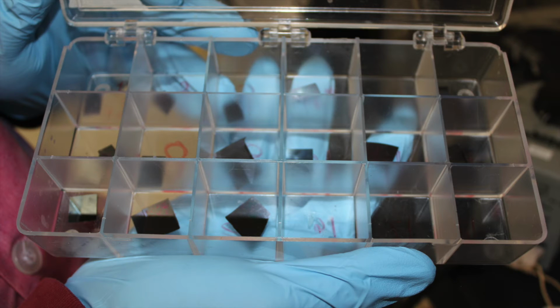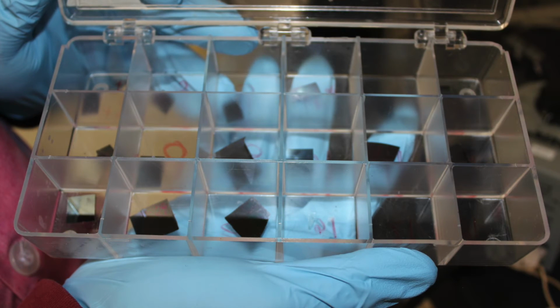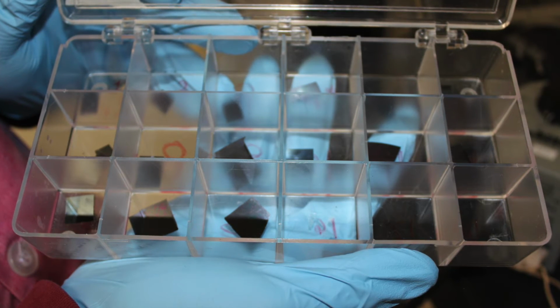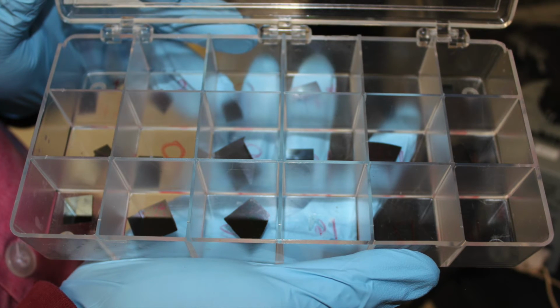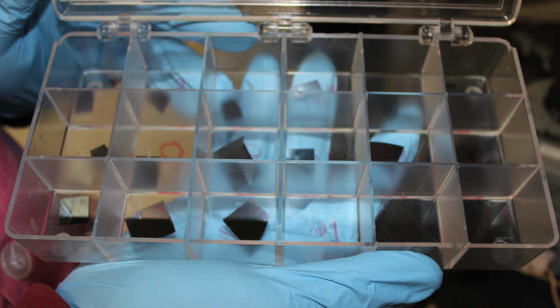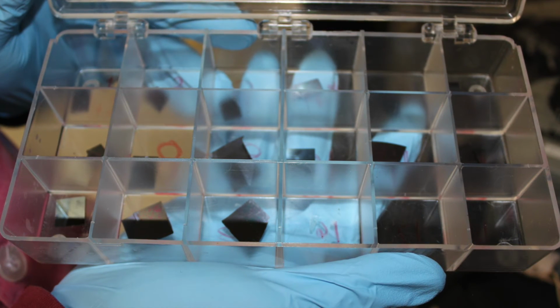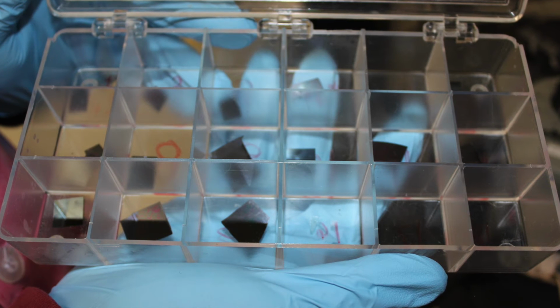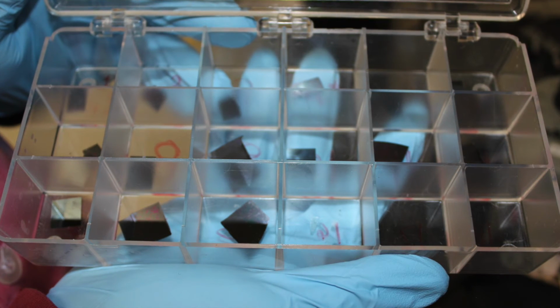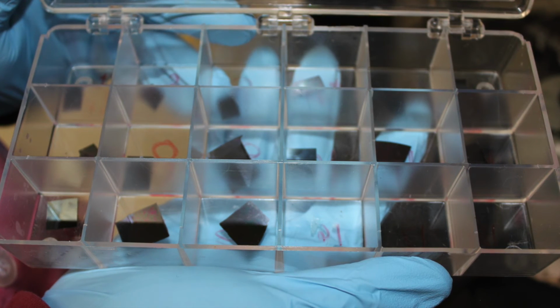The experiment succeeded in polymerizing hexyl acrylate to a silicon substrate. However, it was not able to accurately solve for reaction activation energy. This may have been in part due to physical condensation of hexyl acrylate in vapor form. During one trial, a glass plate was suspended over the substrate. This resulted in a thinner polymer film, which would not be the case with chemical vapor deposition as it only occurs on a surface level.